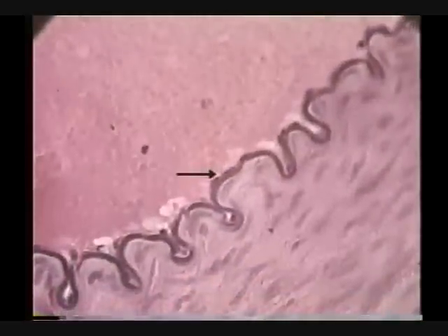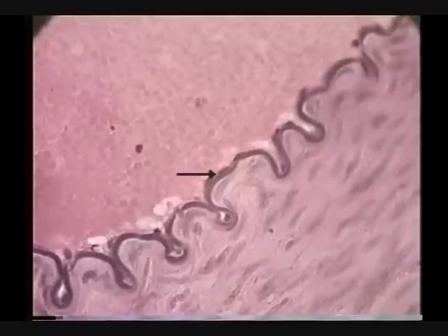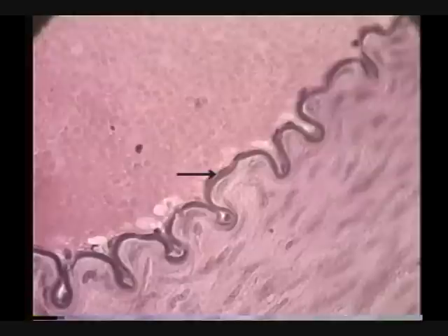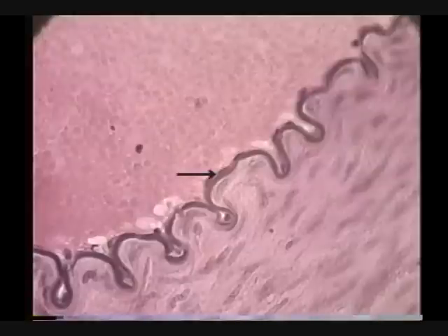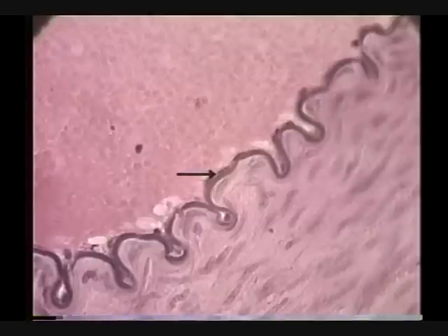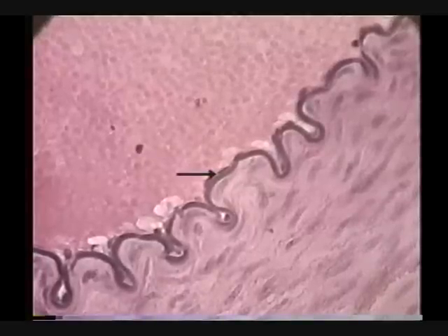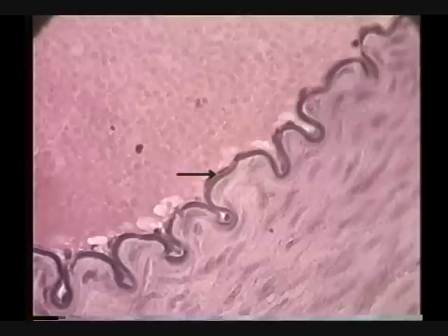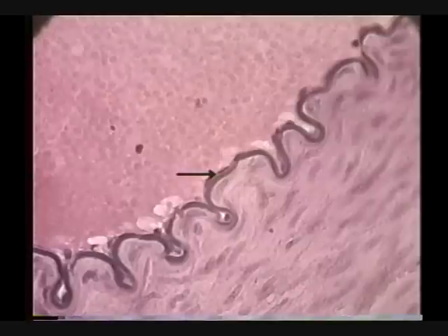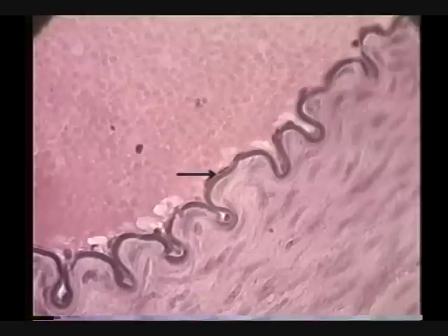I come over and I see — identify the tissue exactly indicated by the pointer. You can see three nuclei there. The tissue is simple squamous epithelium. You can see three nuclei right along there — little flat ones. Squamous means flat. And what layer is that? Endothelium.